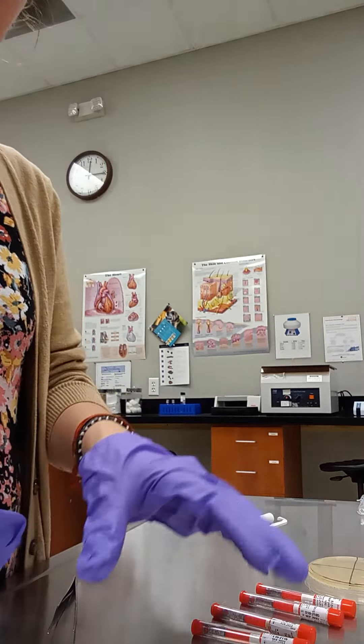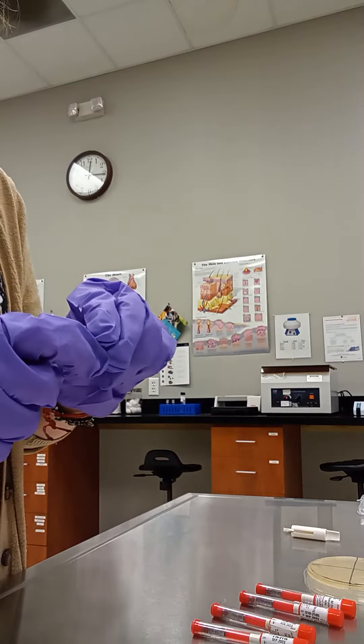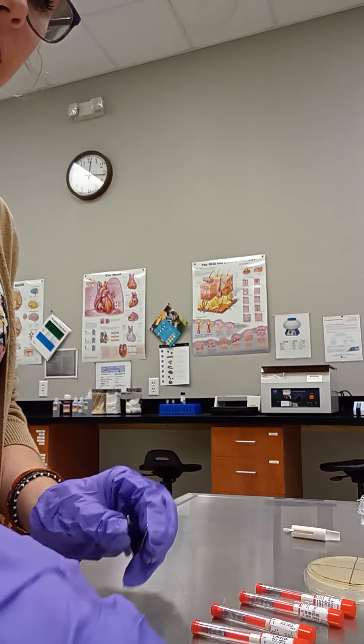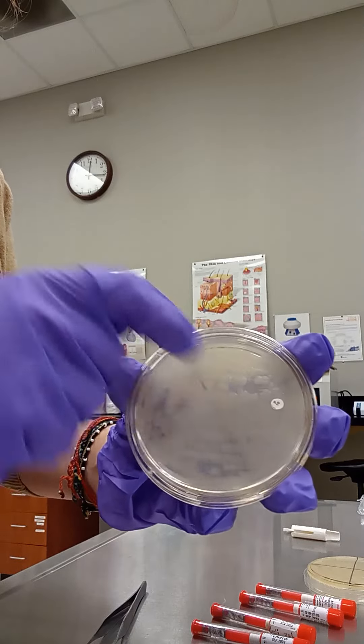Let's go ahead and do this one first. I'll get my container ready and get one of my pieces of paper — they're just these little paper discs. Once I pull one off, you can see they're very thin. There's our paper disc for the penicillin. We're just going to open our plate and drop it on, and you can kind of tamp it down just to make sure it actually makes contact with your sample. I'll go ahead and do that with all of my other antibiotic discs until I have one spread across the different portions of the plate.